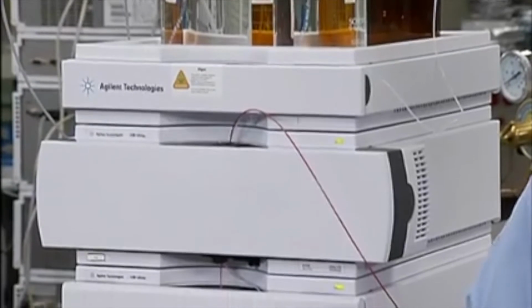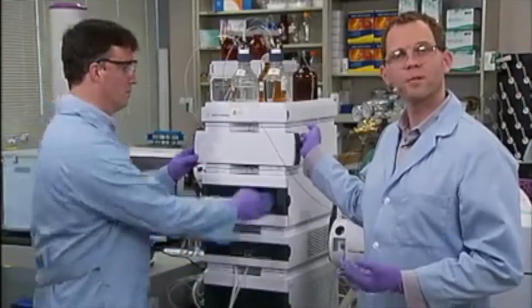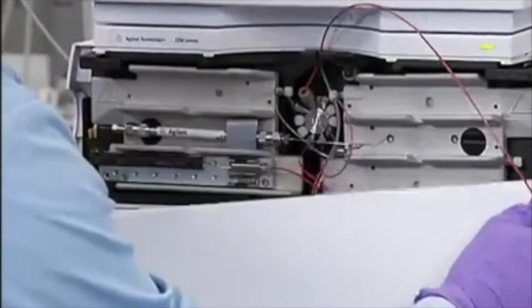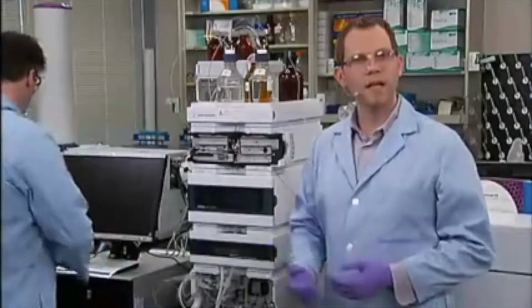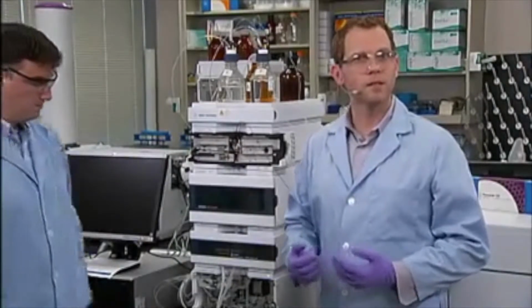We're working today with an Agilent 1290 Infinity LC system. The maximum operating pressure of this instrument is 1200 bar, or about 17,000 psi. First, we'll check out the tubing and ensure it's as short as possible. We want to make sure to minimize any extra column dead volume in the system, so we want to be sure we don't have any pieces that are too long.